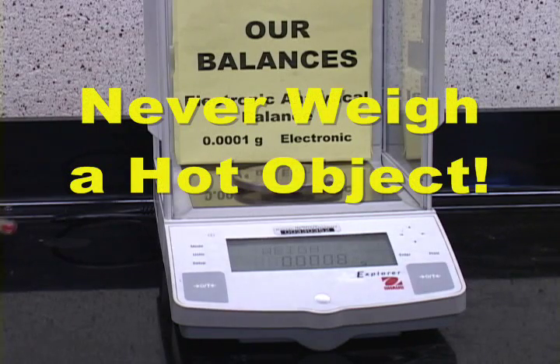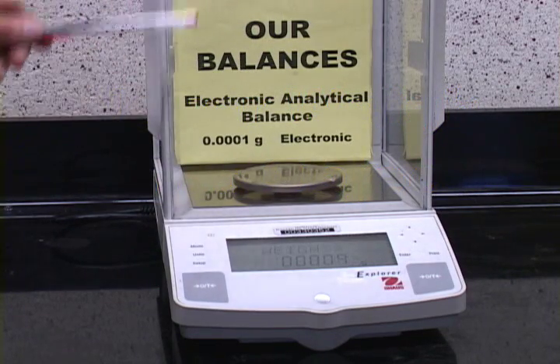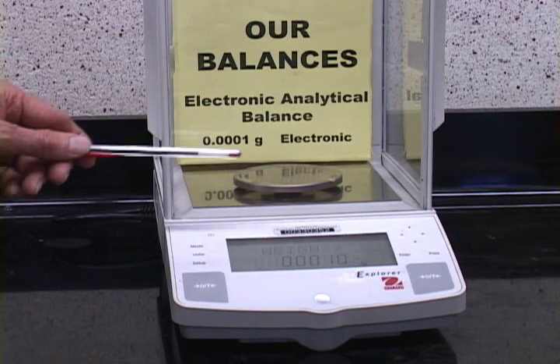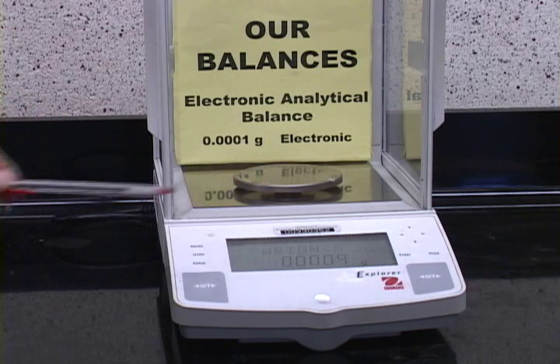Never weigh hot objects on an analytical balance. The closed container will set up convection currents of the heat rising and falling, and this will make the object appear to weigh too little. Furthermore, the object will change weight with time.